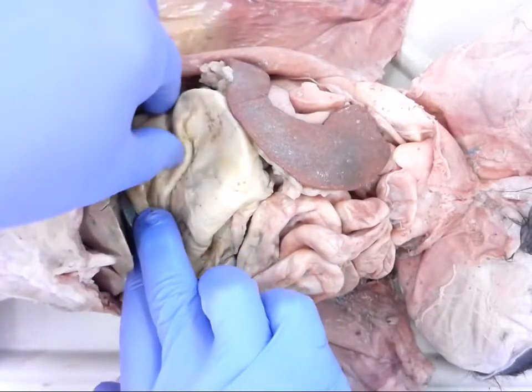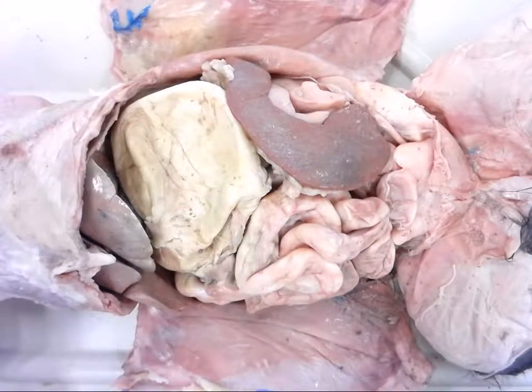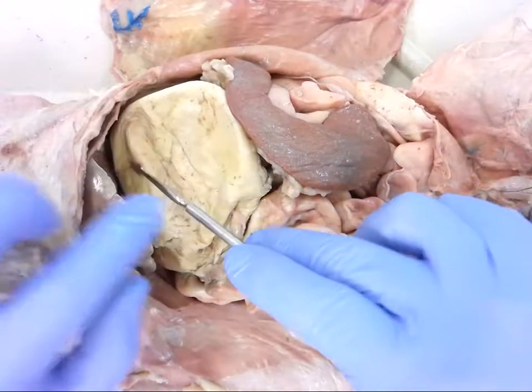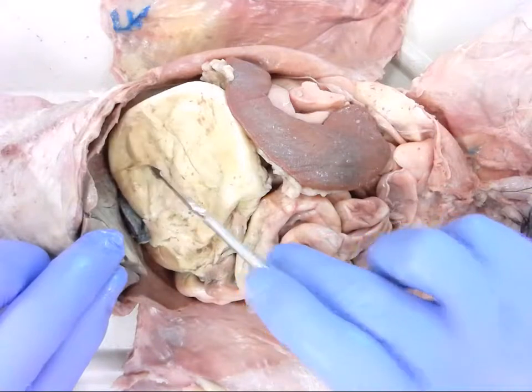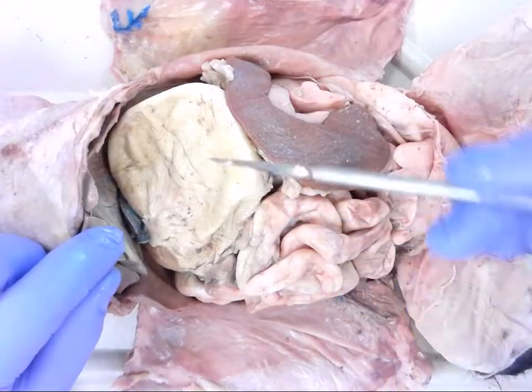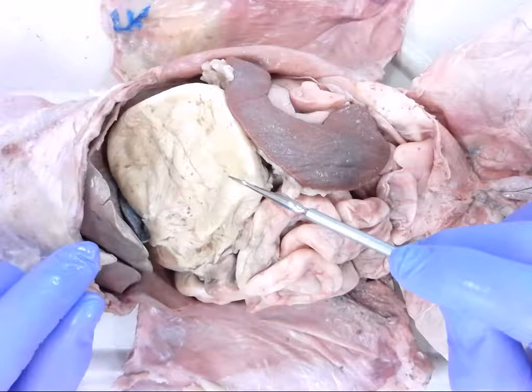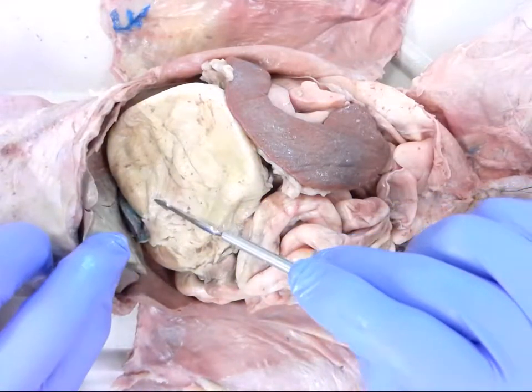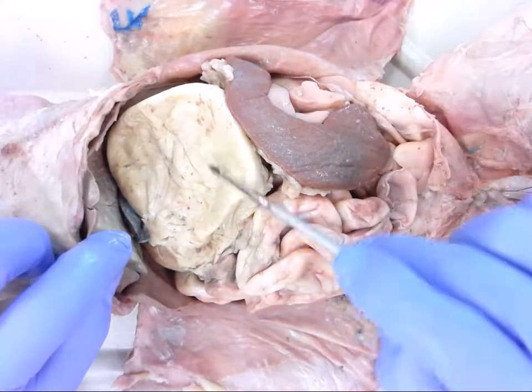As we discovered in the digestive unit, the stomach is there to mechanically and chemically digest food. It is J-shaped — if you refer to your reference sheet or find any picture online, you'll see it's J-shaped. Up at the top it extends just a little bit above the entrance opening for the esophagus, and this upper part is called the fundus. Then we get into the body, which is the main portion of the stomach.